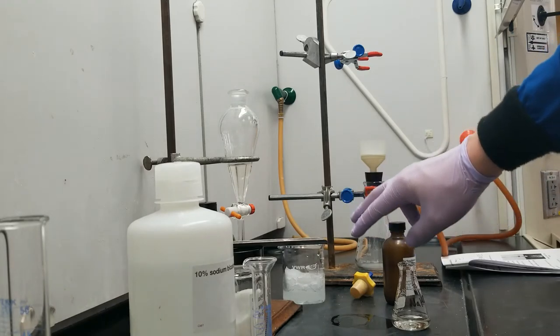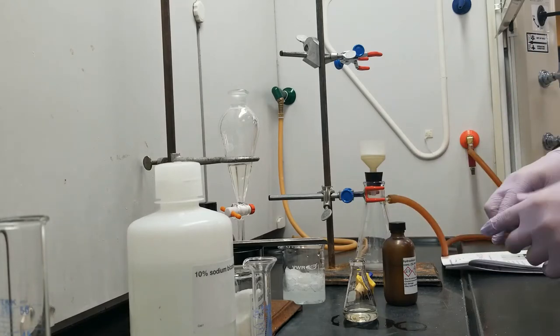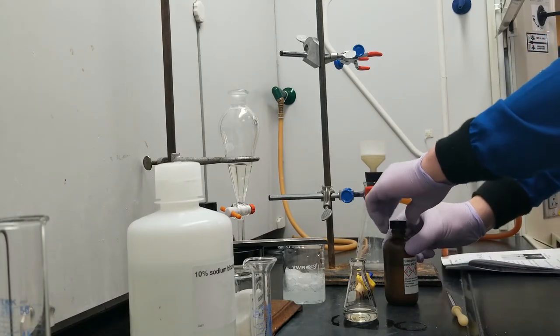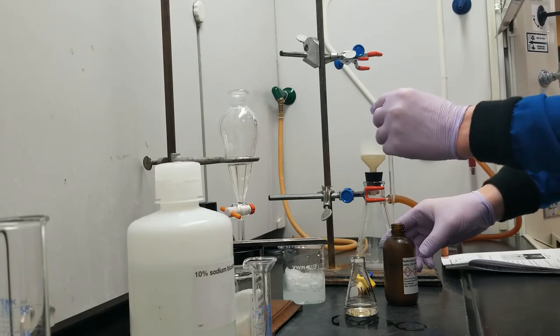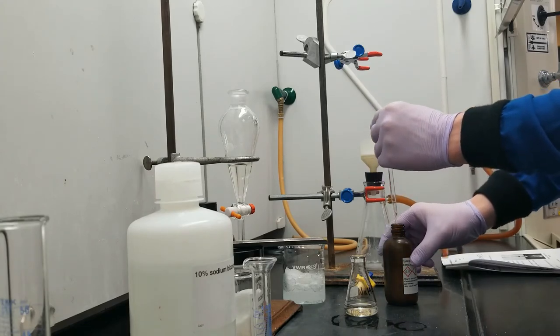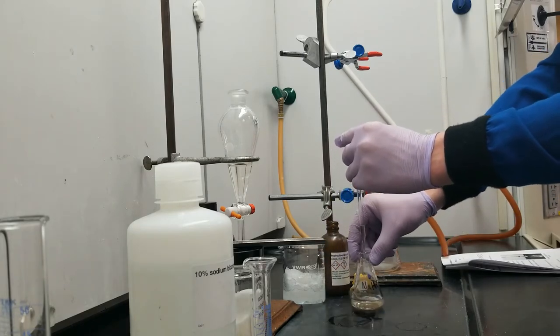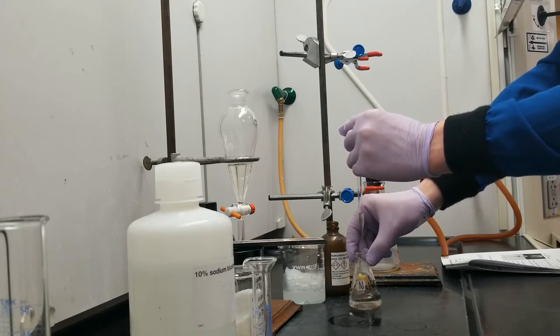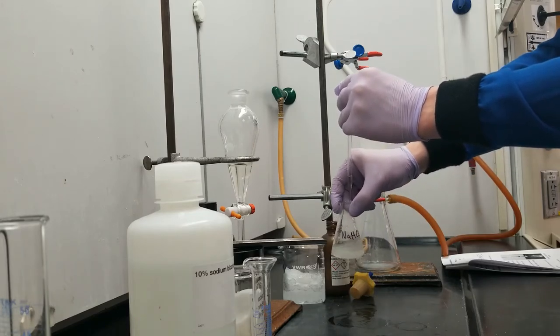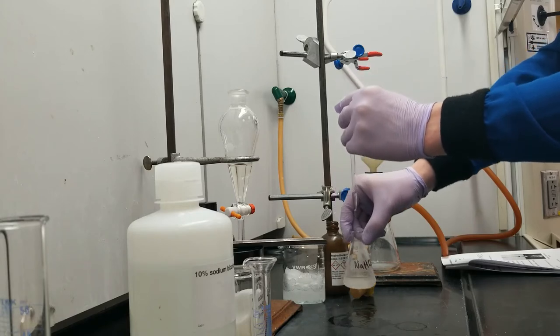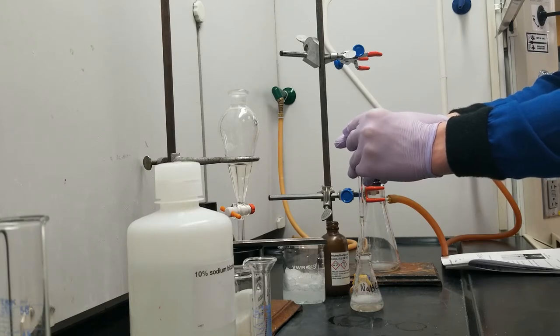Just double-check that you can see me on the counter over here. A little farther back, perfect. So there's a specific technique that I'm going to use when adding this acid. I'm going to pick up a little bit of acid in my pipette, put it into my container, and I'm going to swirl this as I add the acid. Maybe you can see I'm getting a bit of a white foam, it's getting opaque, and that's fine.